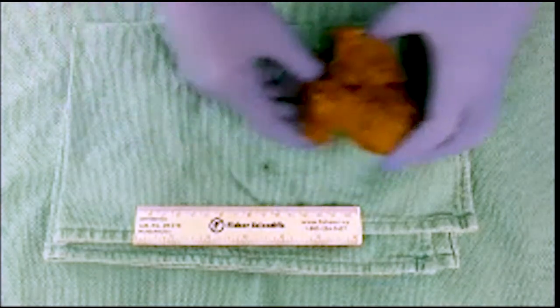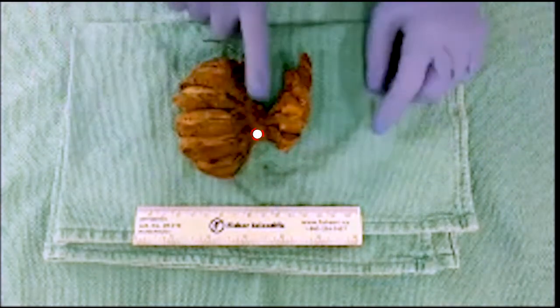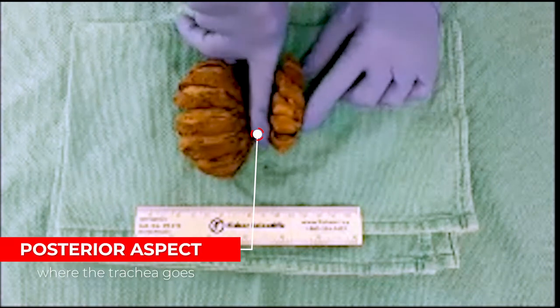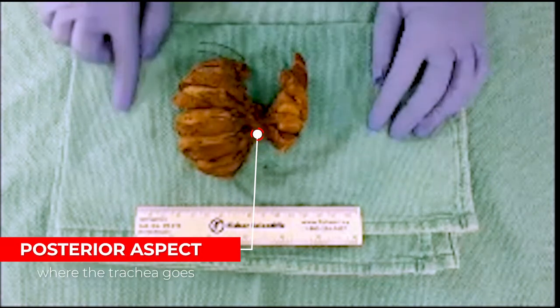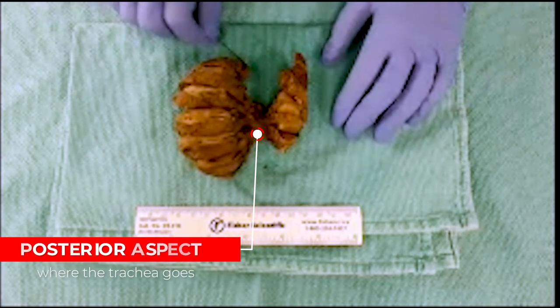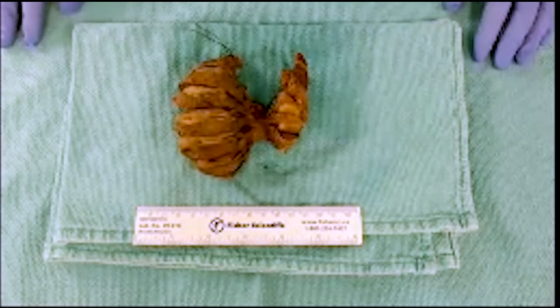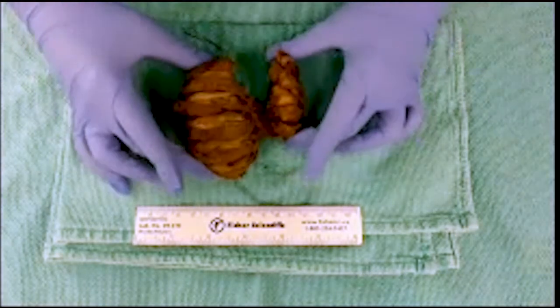The posterior surface is more concave since the trachea sits right in here. A lot of pathology can distort this relationship, so orientation provided by the surgeon is greatly appreciated. On initial examination you can see that the lobes are very differently sized.